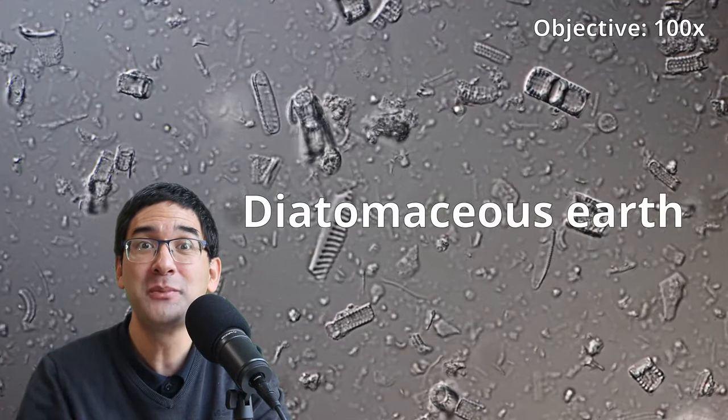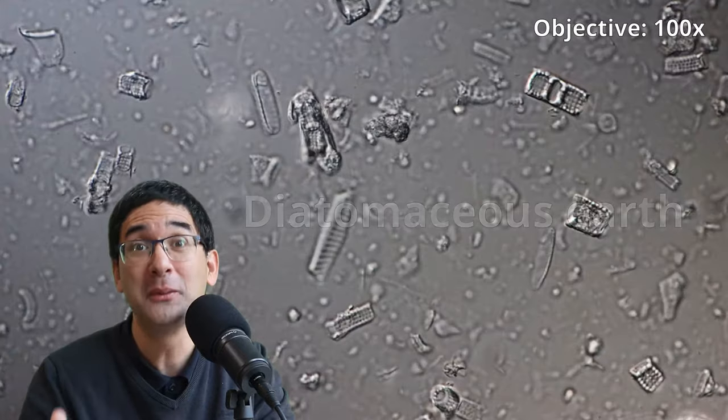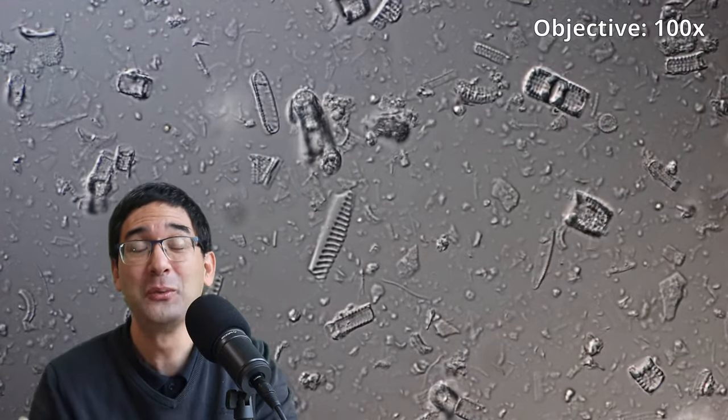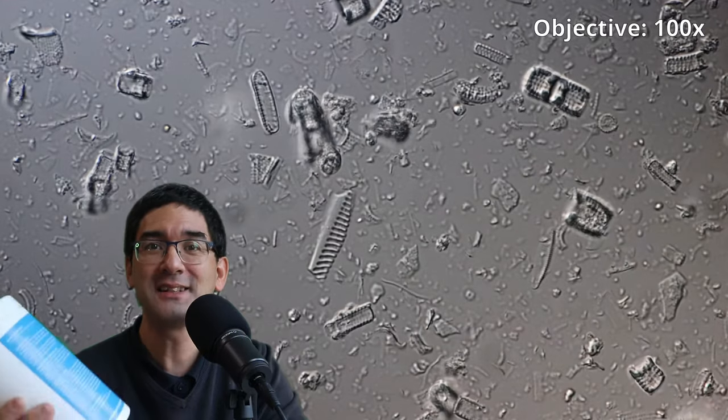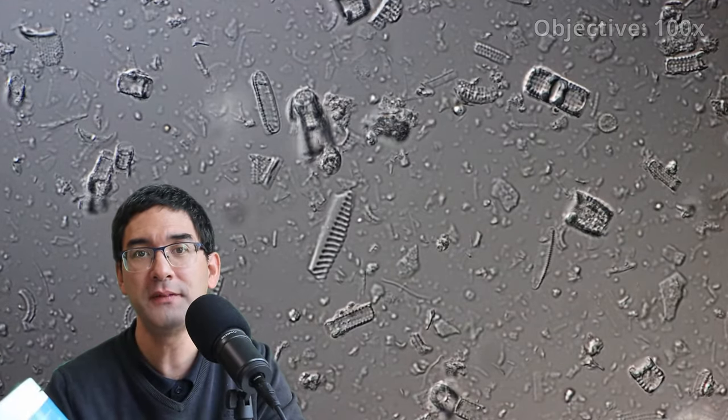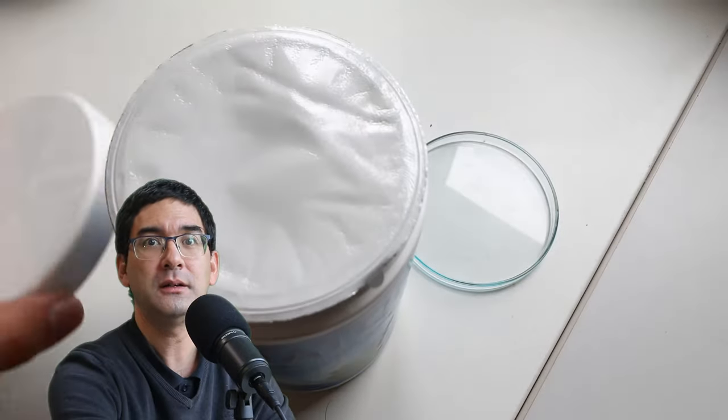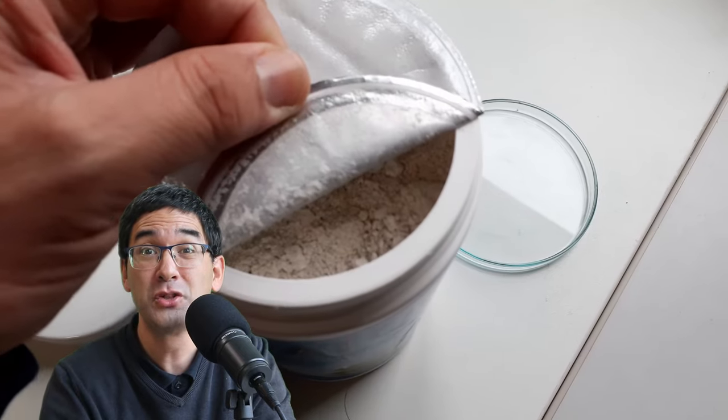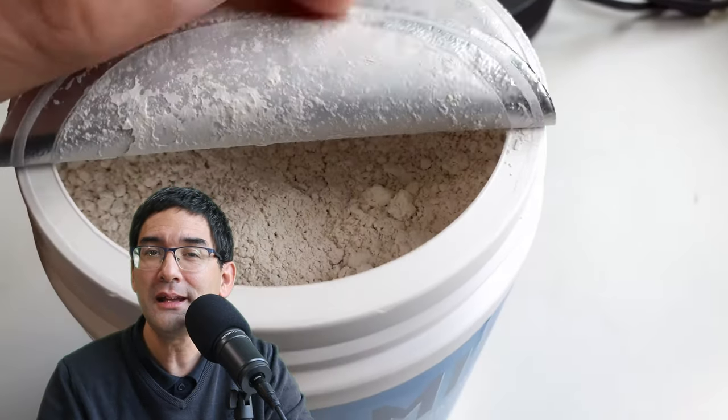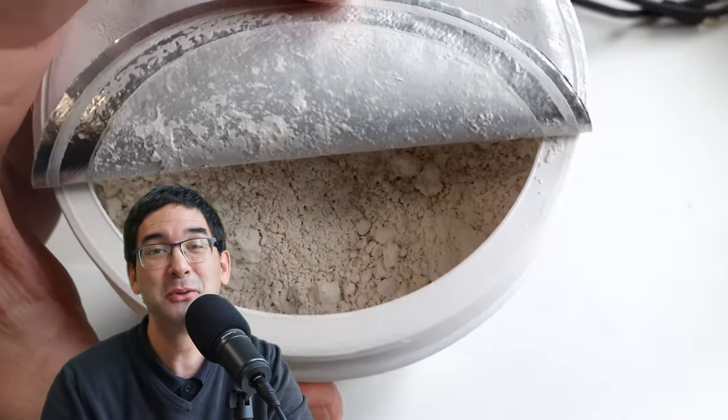This is diatomaceous earth and it's probably 100,000 years old. Diatomaceous earth can be bought in a container like this as a dietary supplement. I cannot believe this. I probably would not eat it. It's also not indicated on the information sheet what it's supposed to be good for. But in any case, it's a beautiful specimen to put under the microscope.